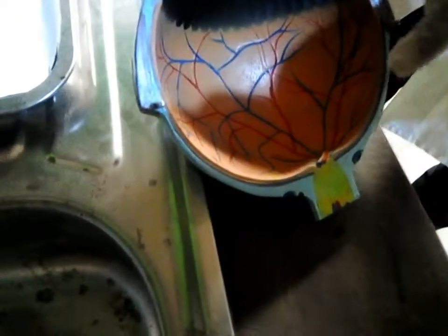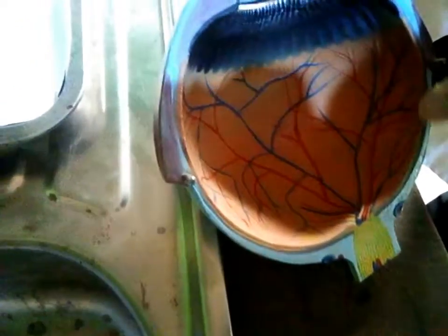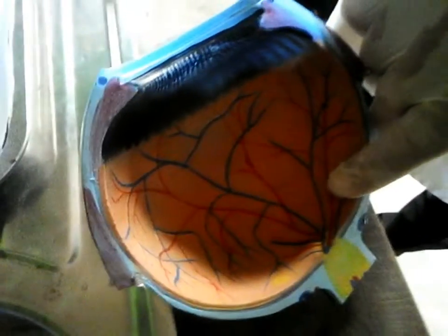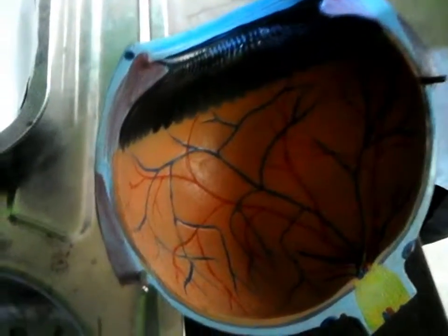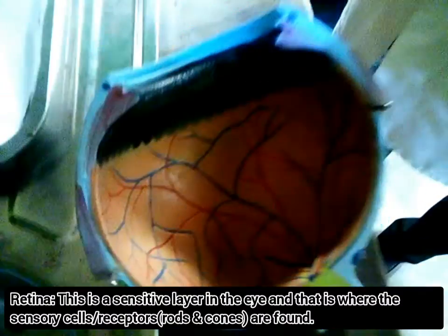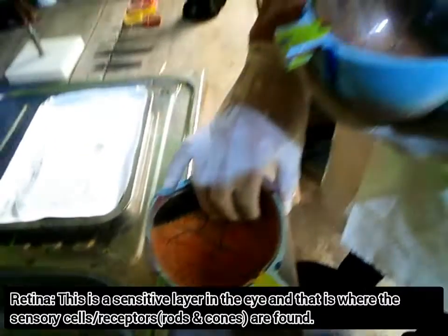Now can you see it? If you look at this, you see the first layer, the sclera, the second layer, the choroid, and the third layer, the retina. Do you get that? And in this retina, this is what you're seeing here, that is where the sensory cells are found.